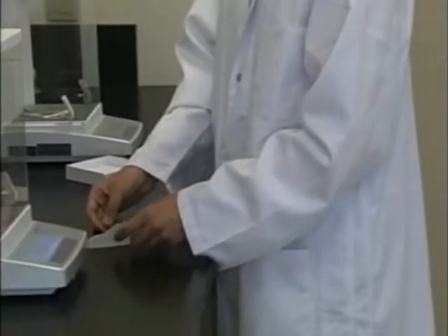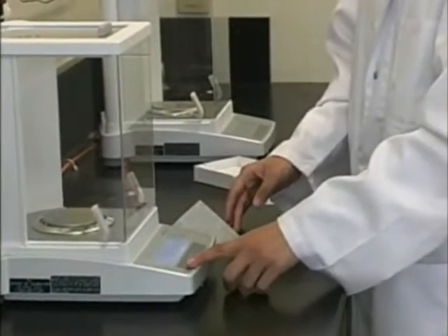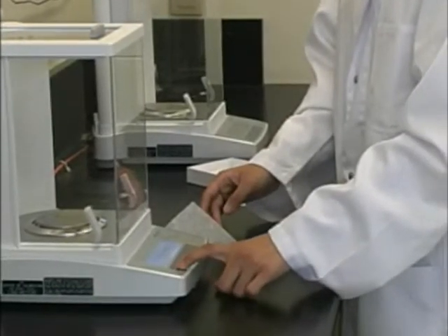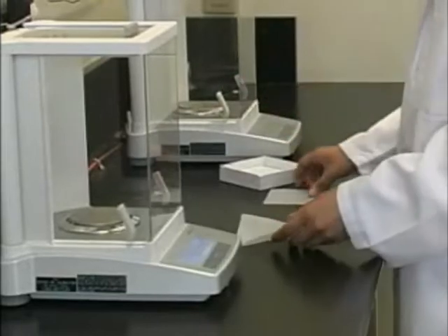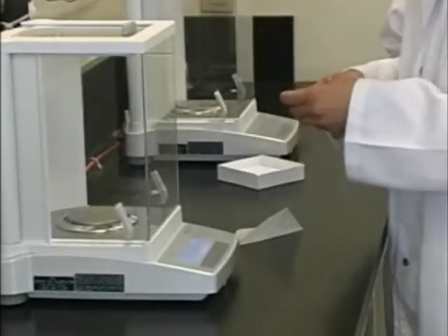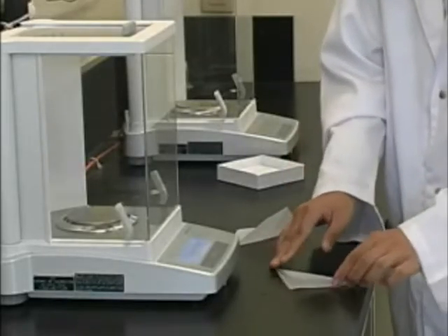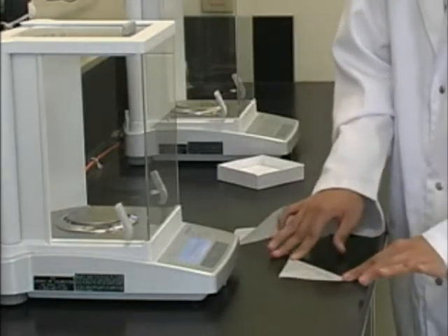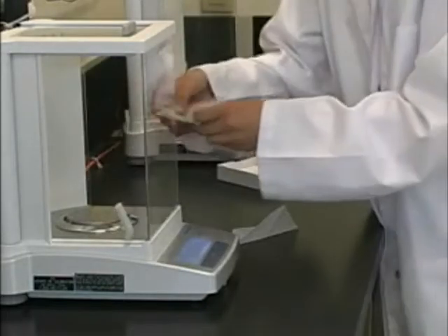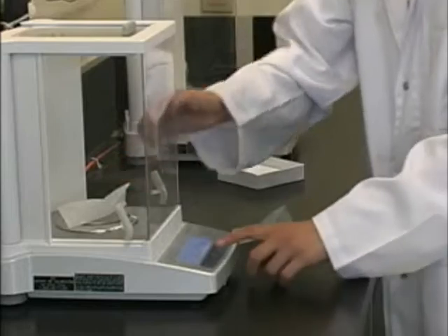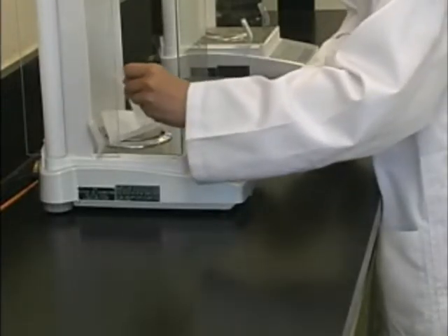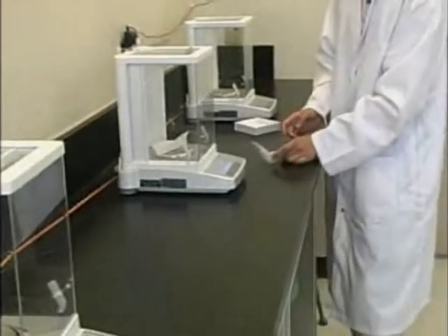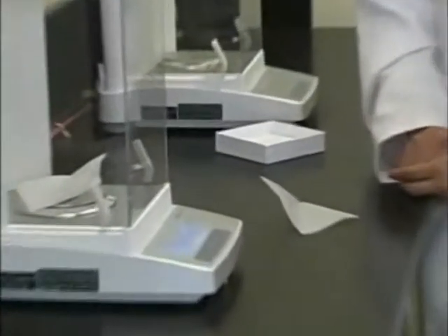Bring your sample of previously sanded and cleaned pure metal to the balance room on a piece of wax paper. Turn the balance on and obtain another piece of weighing paper. Fold it in half at a diagonal and opening it, fold it again crosswise in order to obtain a crease in the center. Place this paper on the balance, close the door and tare the paper. Your balance should read zero. Open the balance door and transfer the metal from the weighing paper in your hand to the weighing paper in the balance. Close the door and note the exact mass of the pure metal.